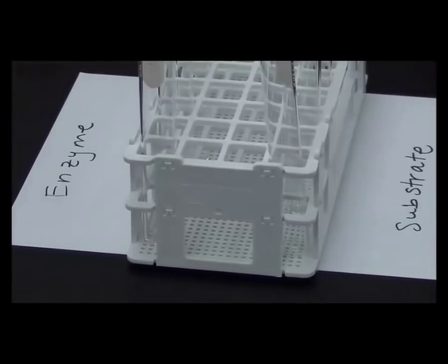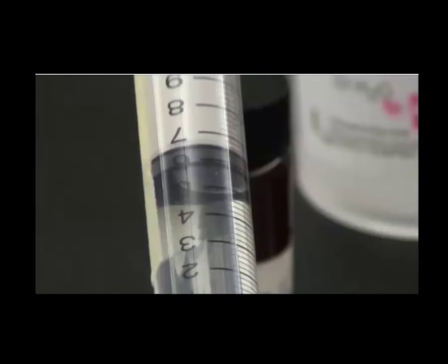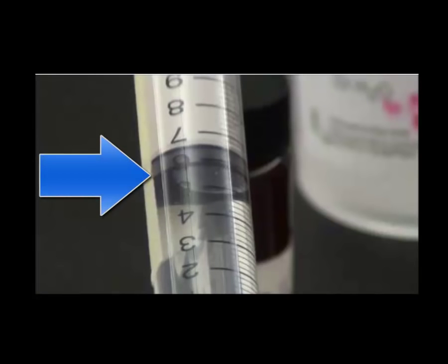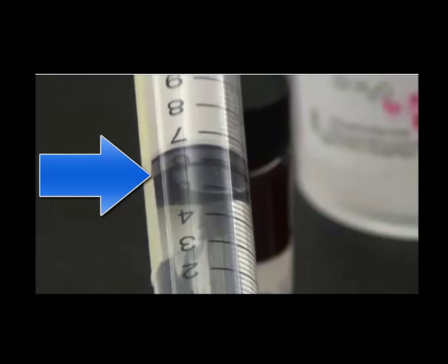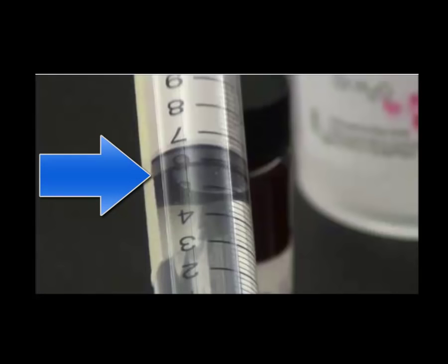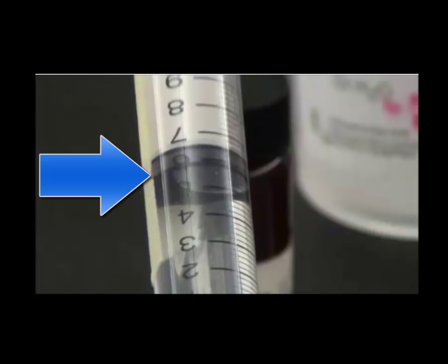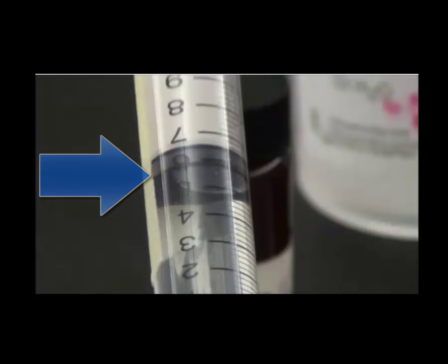Here is a quick example of how to read a syringe. You take a reading at the part that touches the wall of the tube closest to the liquid. So this would be like six milliliters of water, for example.